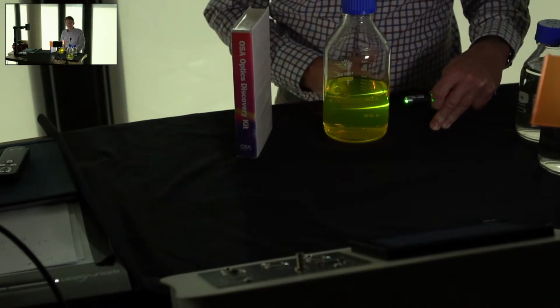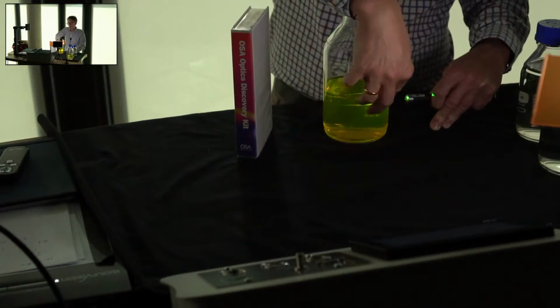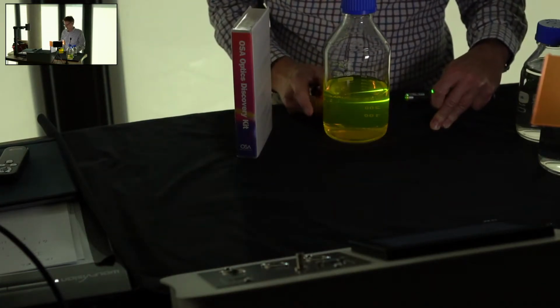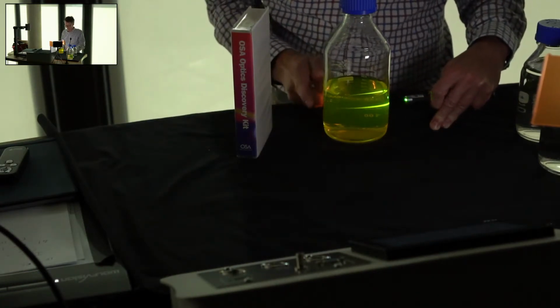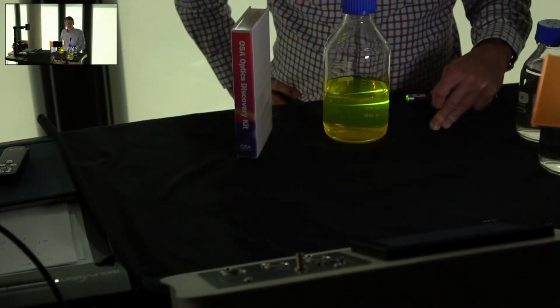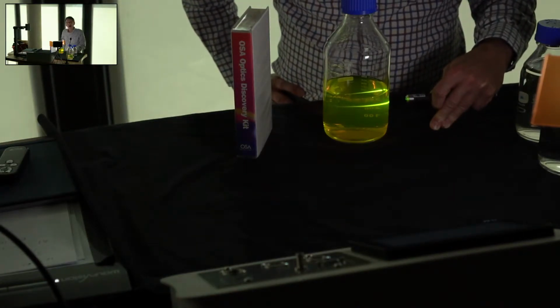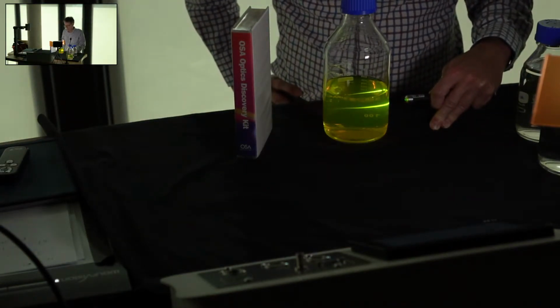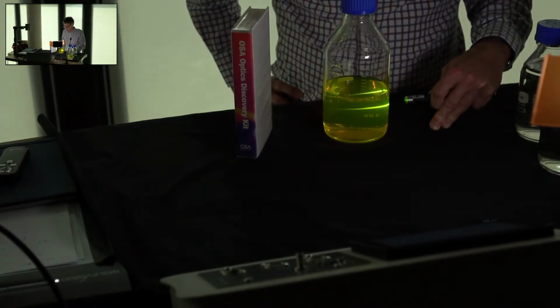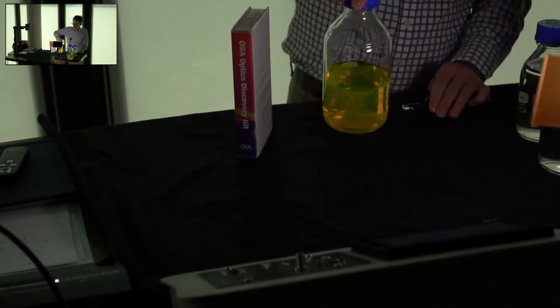What you can nevertheless still see is a very strong fluorescence signal all the way across the sample. Of course, where all the photons have been absorbed from the beam, then of course there's no signal from fluorescence either. But you get the idea. So even at these high concentrations, you can still get a very strong signal, of course, in fluorescence, but not in absorption. Let's take another sample.